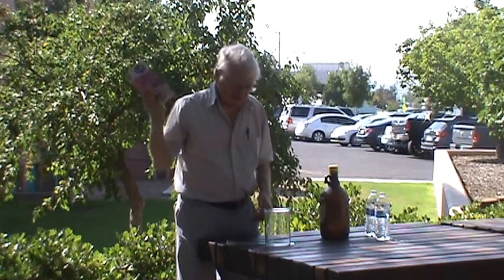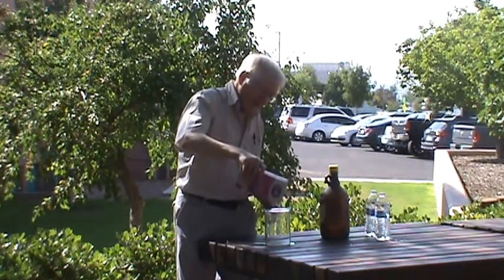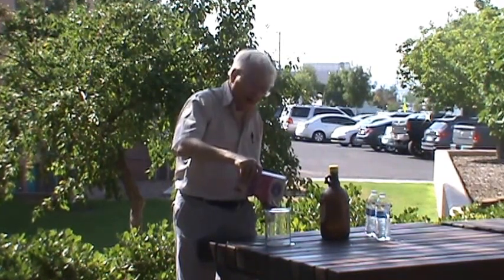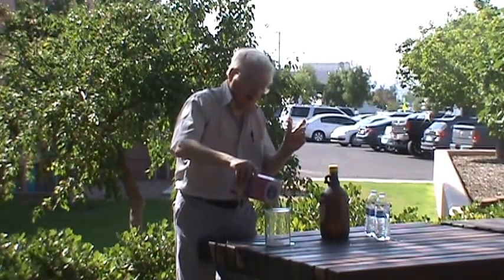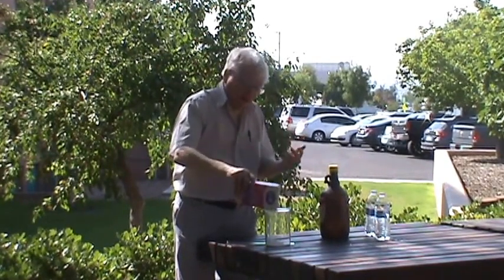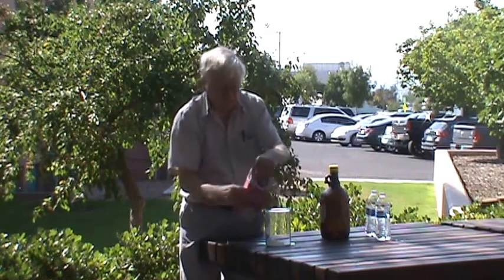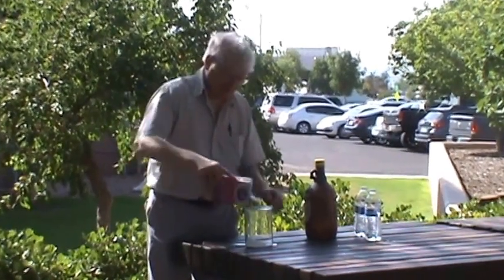It's a demo that demonstrates that carbohydrates are carbon and water. This is ordinary cane sugar, which is essentially sucrose. Sucrose is a disaccharide made of a glucose molecule and a fructose molecule. They're both six-carbon sugars.